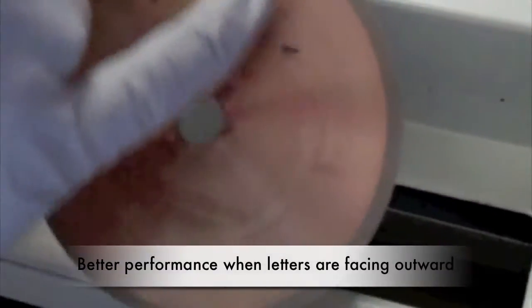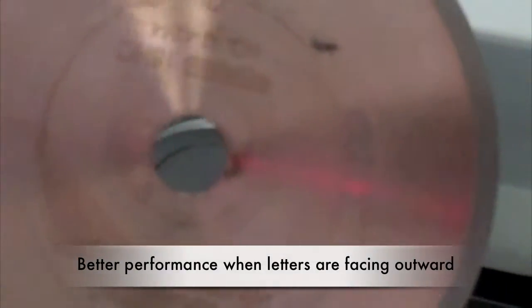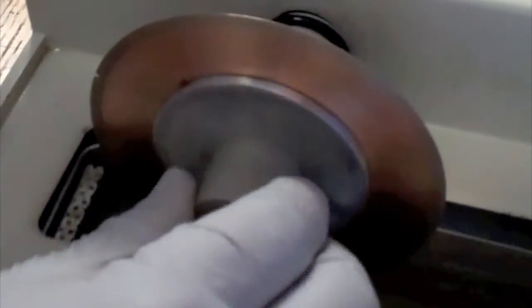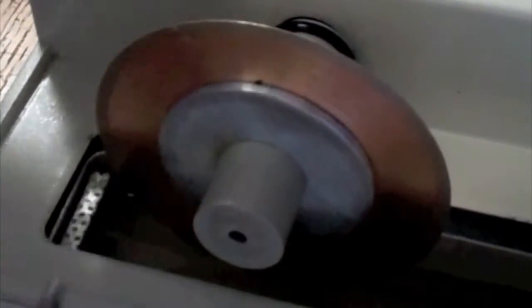The machine was found to best operate when the blade lettering is facing out. You can see the lettering on just one side of the blade. Then you can re-secure the blade by adding back the screw and the round plates.